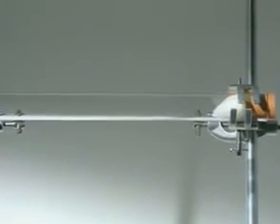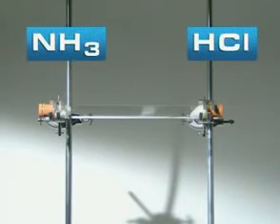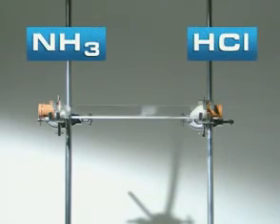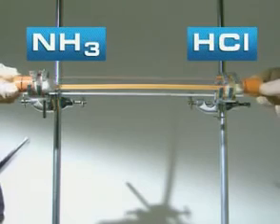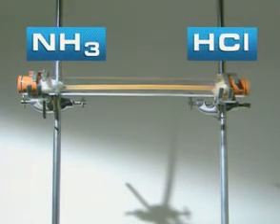You can compare the speed at which they approach each other by looking out for a cloud of ammonium chloride. After less than a minute, a white ring begins to form, marking where the gases meet. The white solid is closer to the hydrogen chloride end of the tube, on the right. So which gas has travelled faster? Another way of monitoring the progress of the gases is to run a piece of damp indicator paper along the tube.